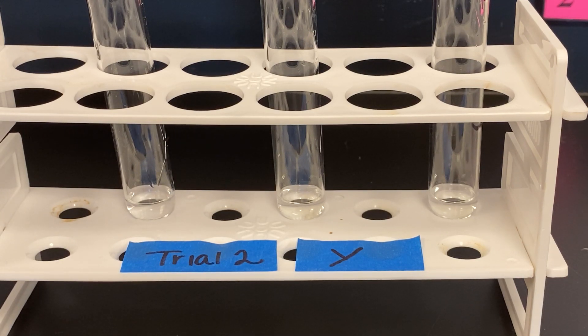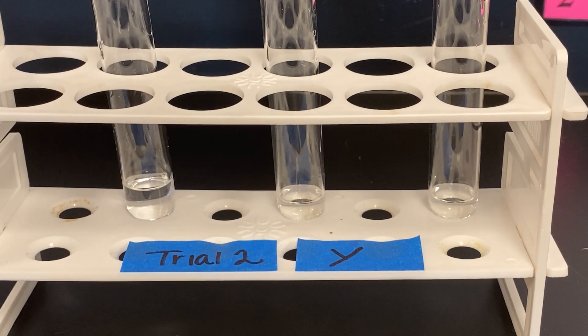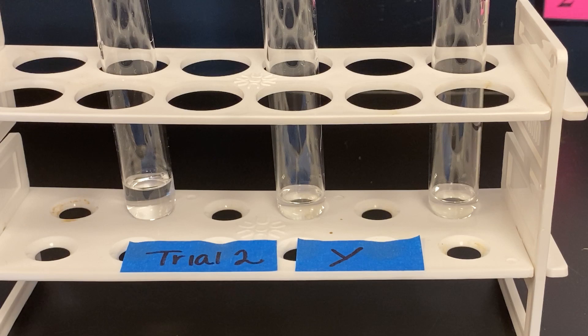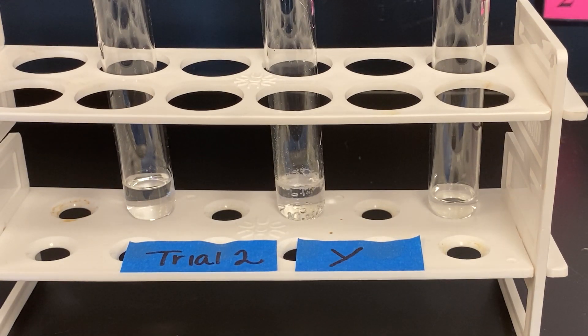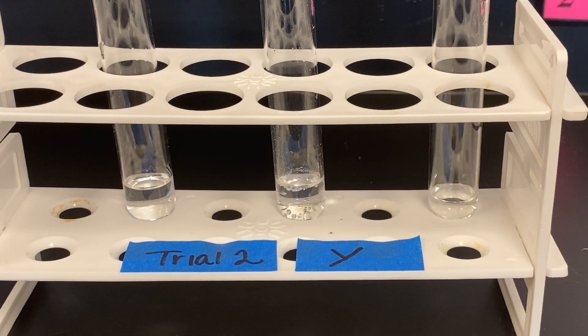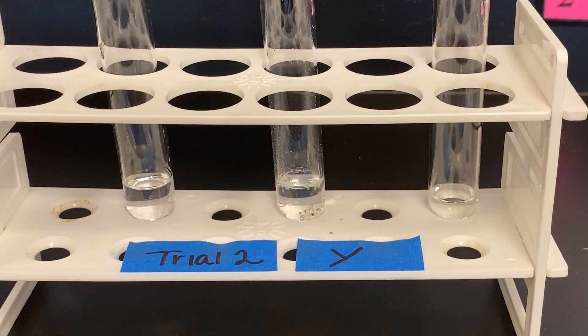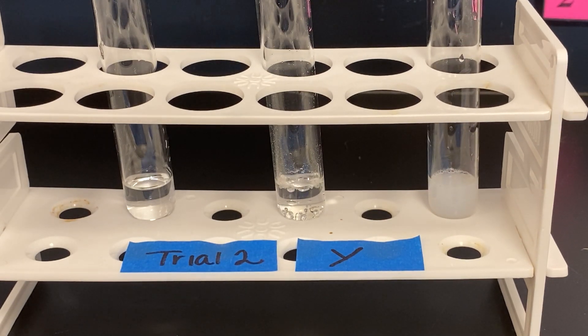Then we will start as we did in the first trial. We will add solution Y to solution Y and observe. Solution X to solution Y and observe. Solution Z to Y and observe.